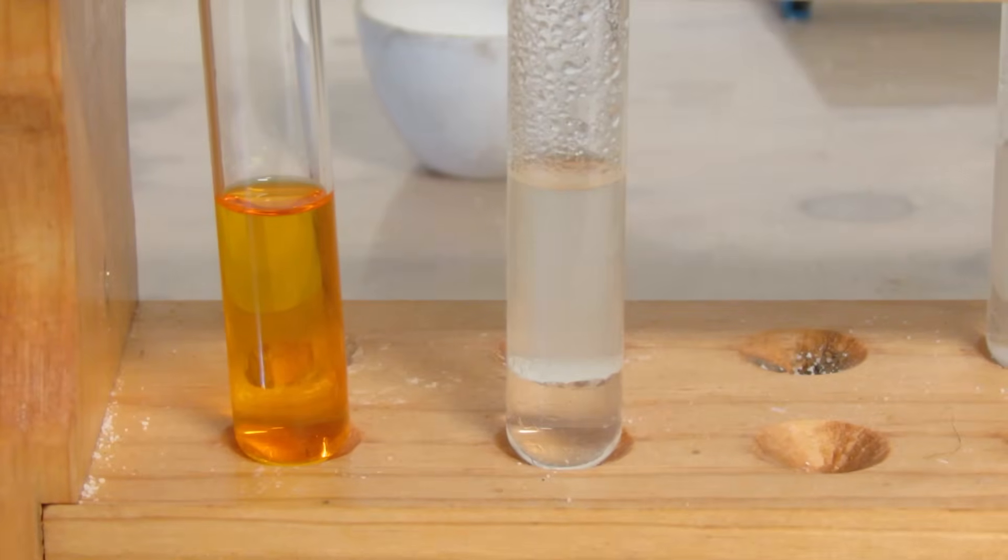Here are the two test tubes side by side. I'm now going to explain what happened here.